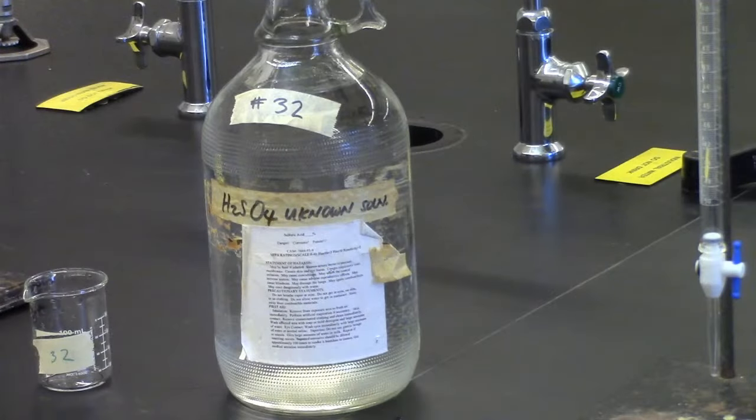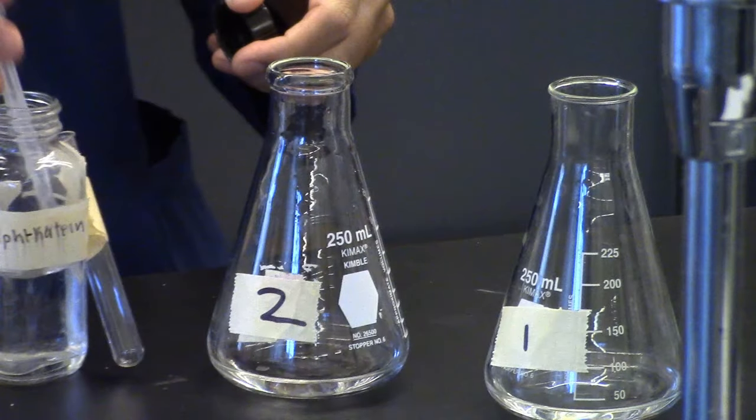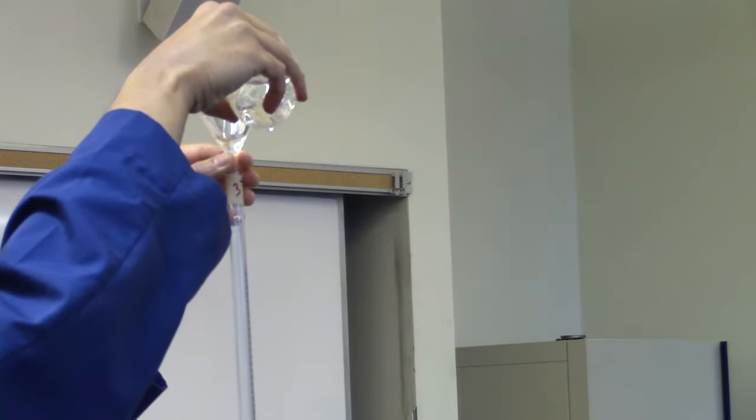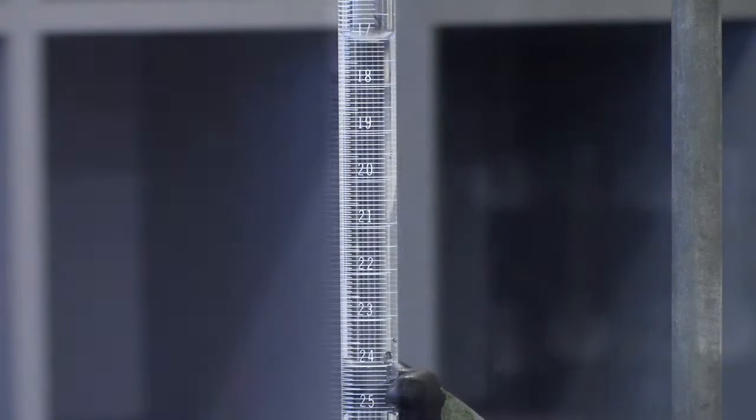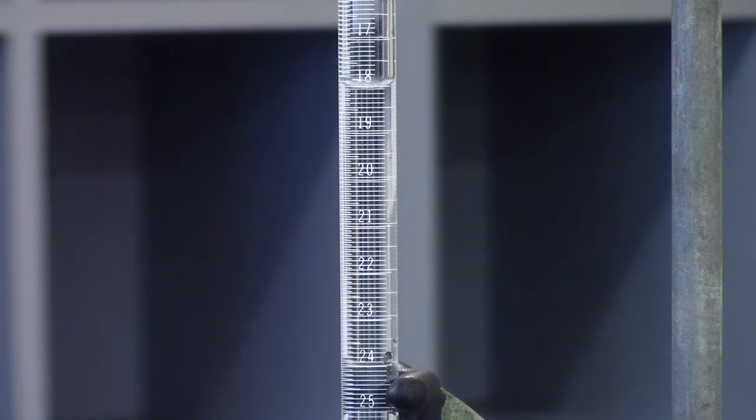The sulfuric acid will be measured with a burette. Take two clean flasks and using a burette containing the unknown record initial burette reading. Dispense 20.0 mLs of the assigned unknown sulfuric acid into each flask. Remember to record final burette reading.